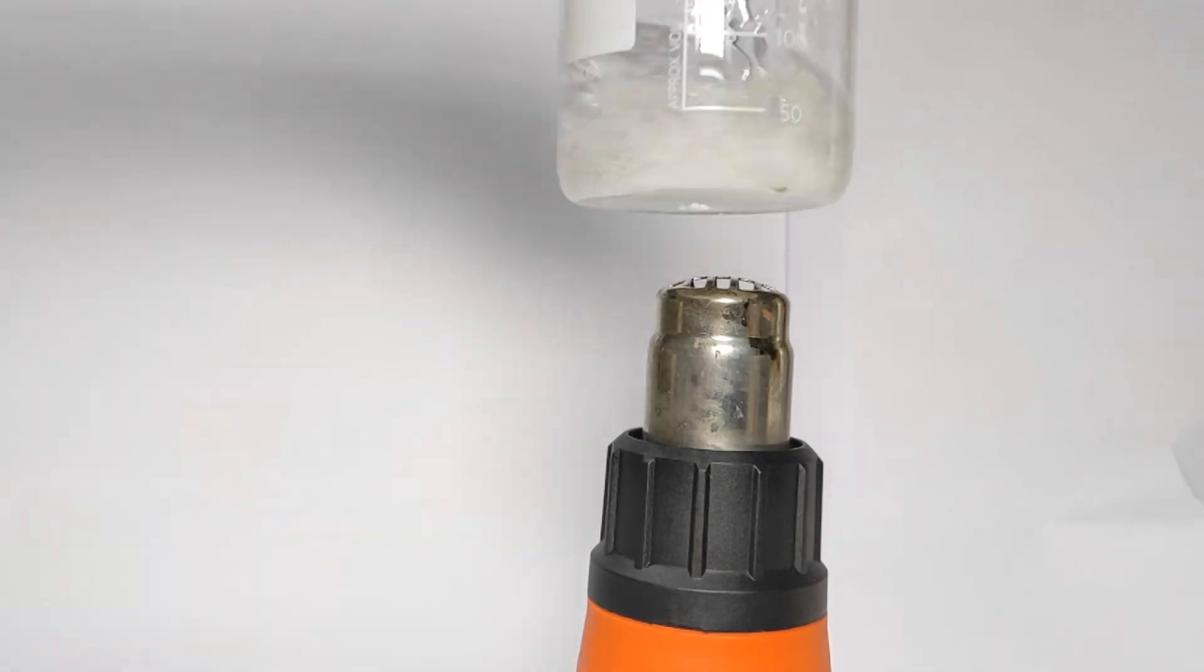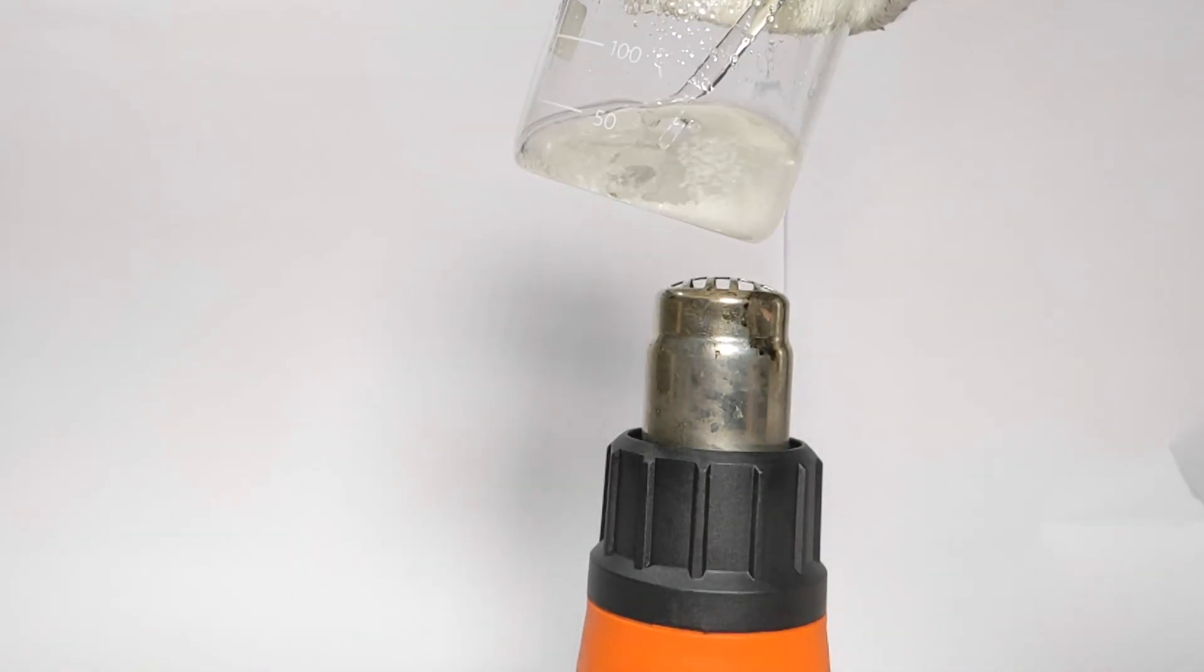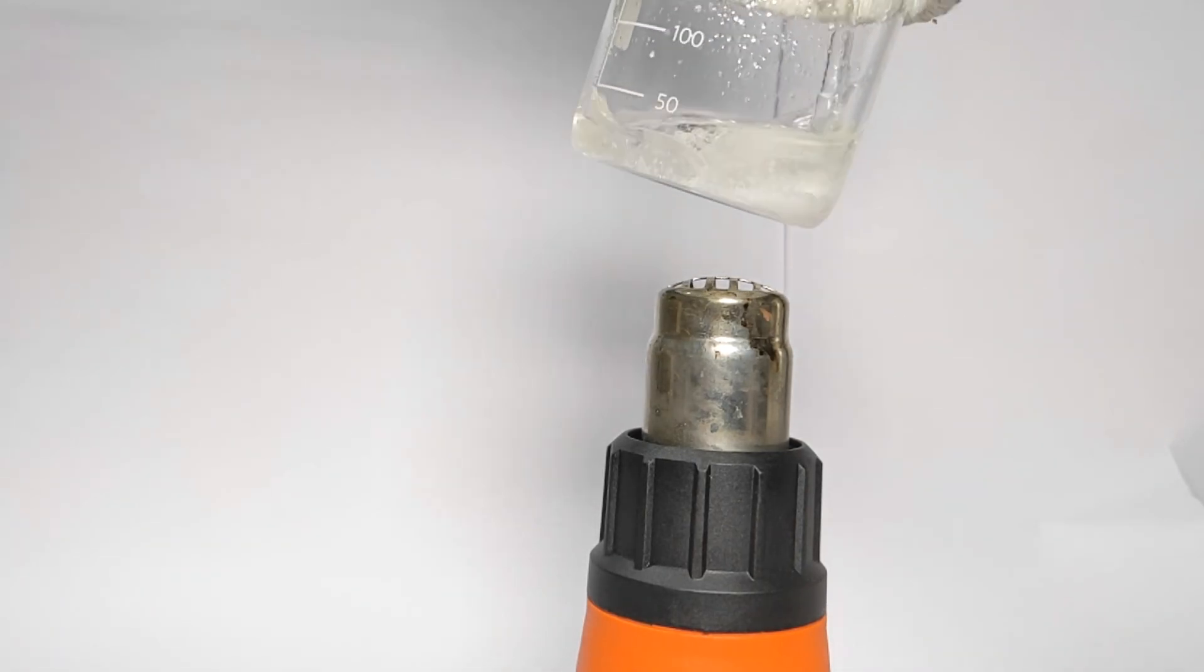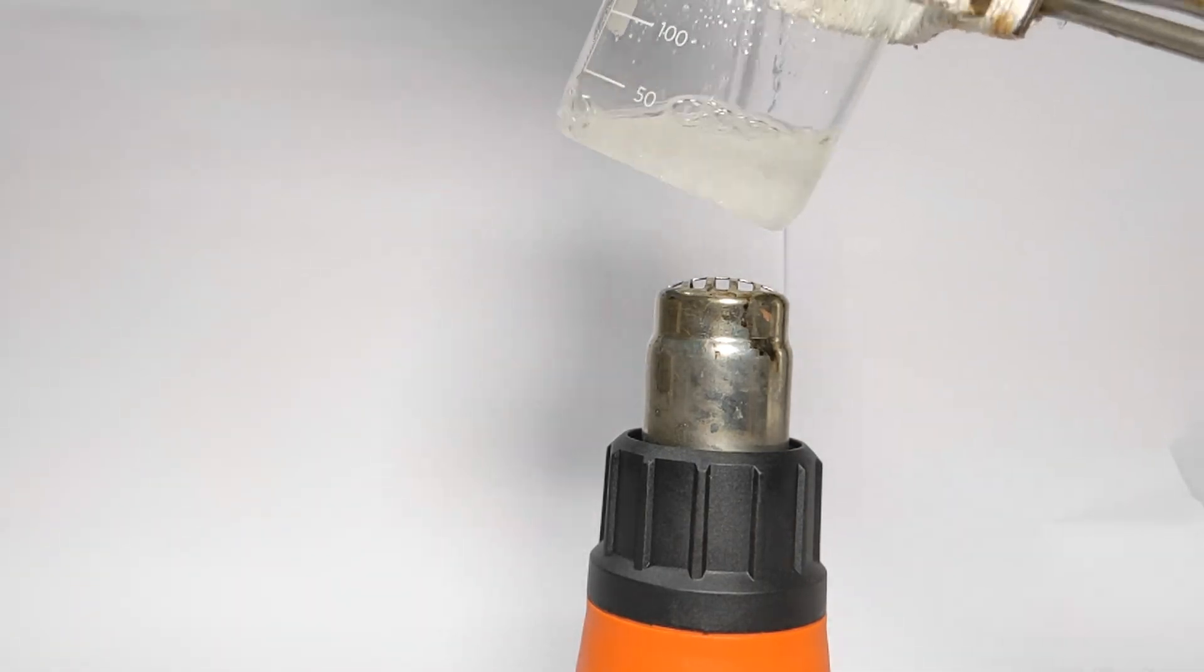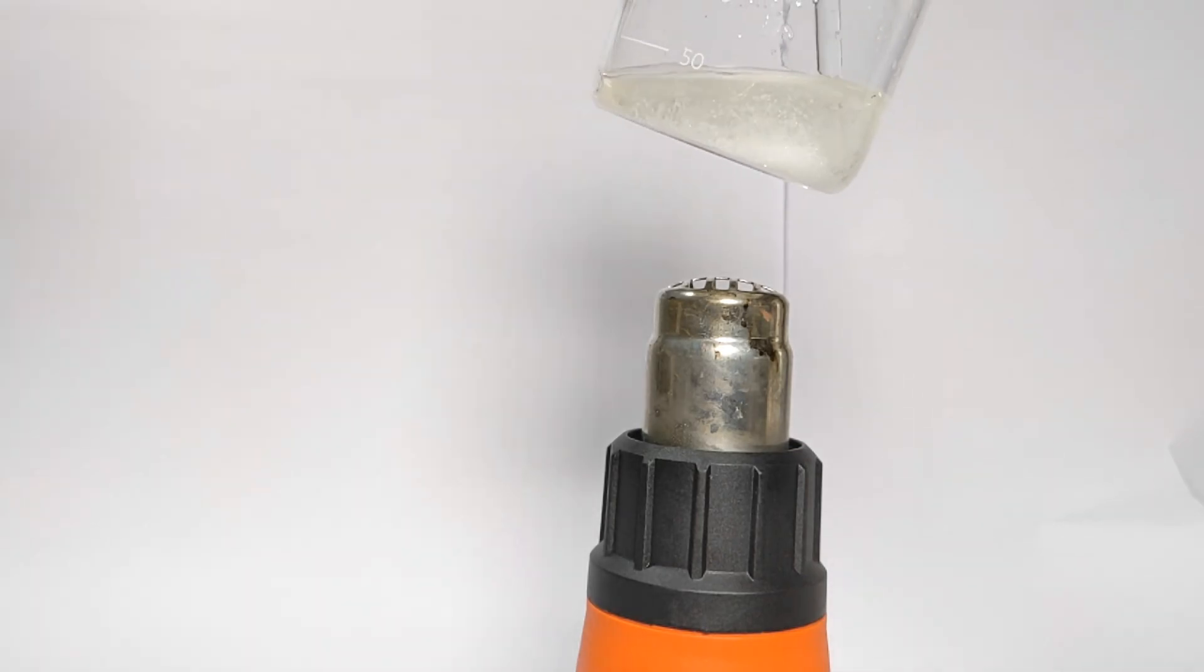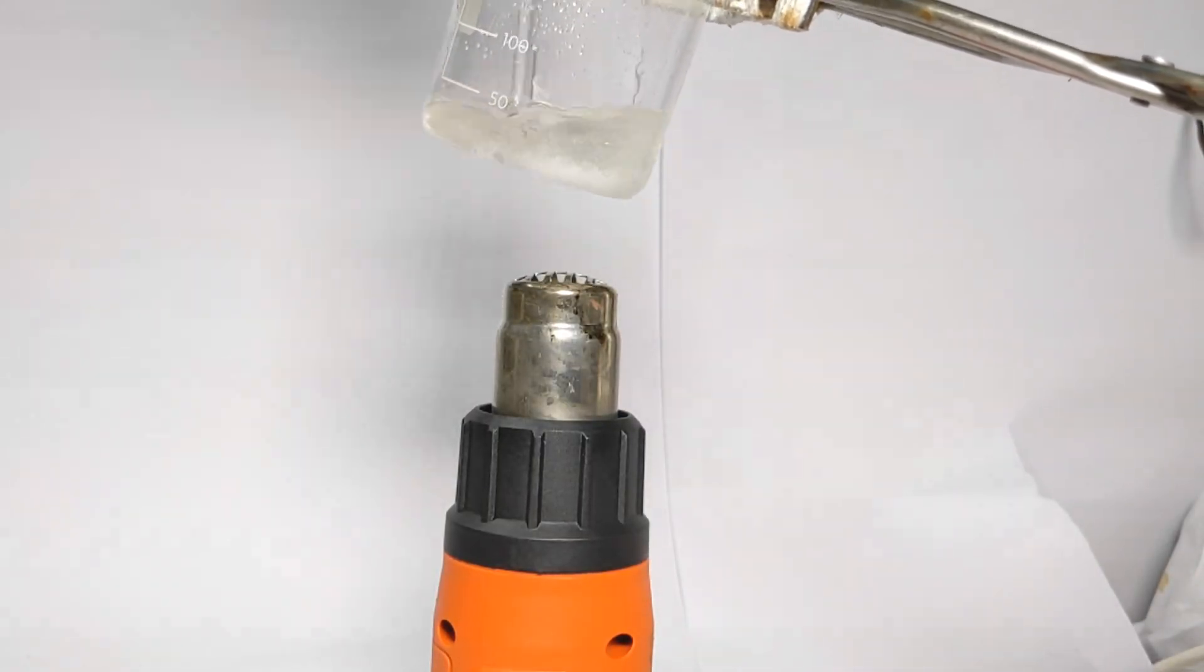Since my hot plate is having some problem, I had to use a heat gun to warm up the contents. This method is very dangerous and could lead to serious thermal injury. I had to do this because I was left with no other choice at this moment.